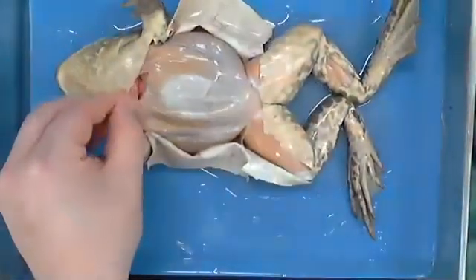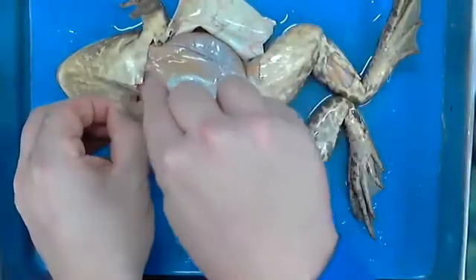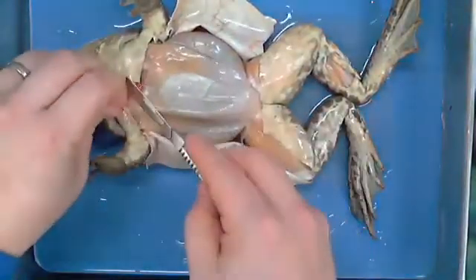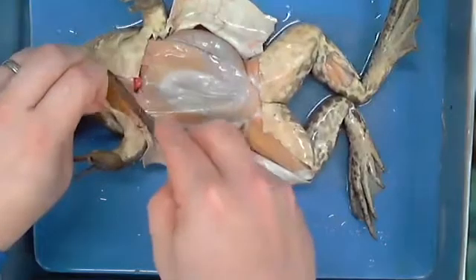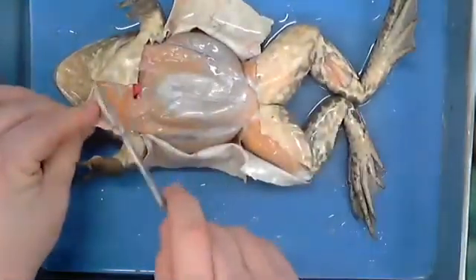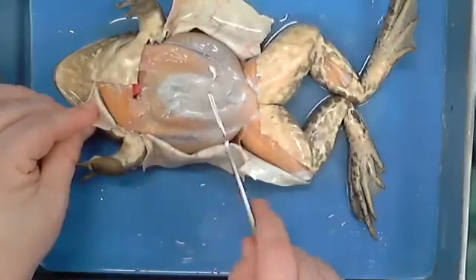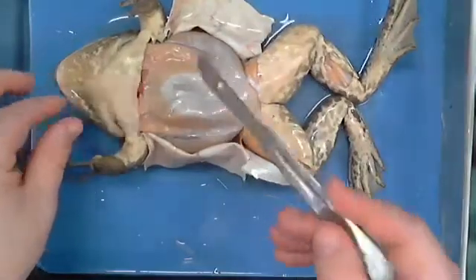I'm going to get the rest of this out of the way here so that you can see a little bit better in just a second, because I'm going to go ahead and open this portion up so that you're not having to fight to see all of this. So let me ask a question. I don't know if you can see the difference, but that is hard. This is not. Somebody tell me why.